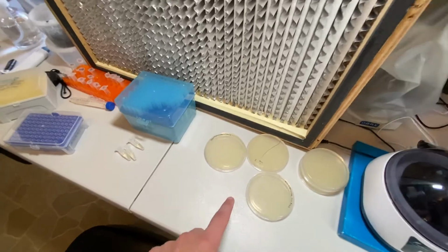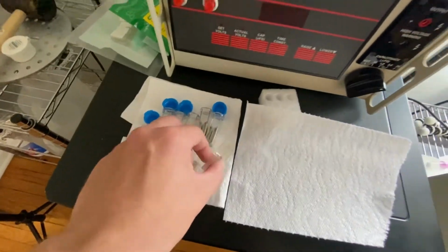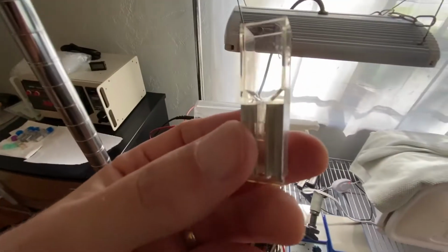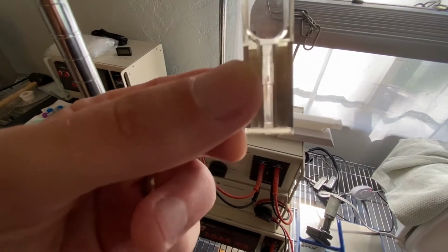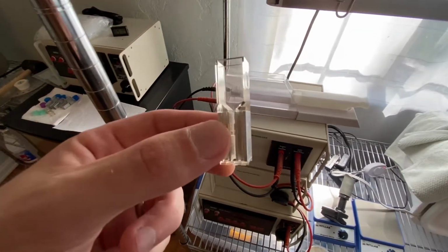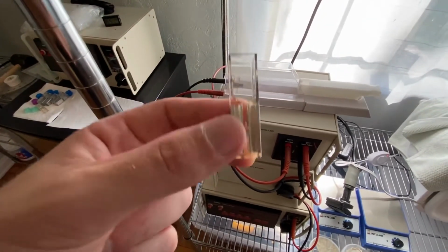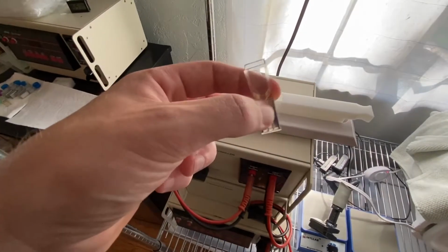But the other thing that I've noticed is after you do the electroporation, so we put the cells in the cuvettes like this, and we pop them in here and we run them. Immediately what we need to do is, if you can imagine, zoom in like the Magic School Bus to the bottom where all those cells have just gotten shocked. You can imagine they're probably extremely hot. They just got a massive jolt of electricity fired through them, in this case 1.8 kilovolts or 1800 volts, and we're talking about cranking that up to 2.5 kilovolts.